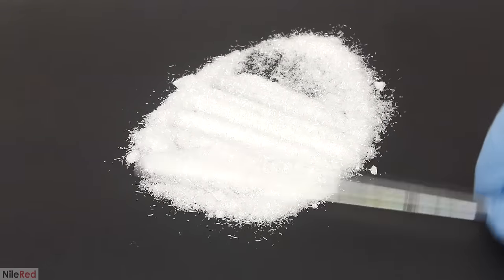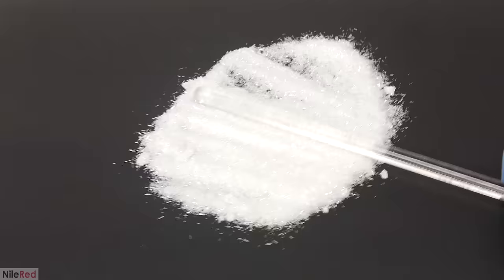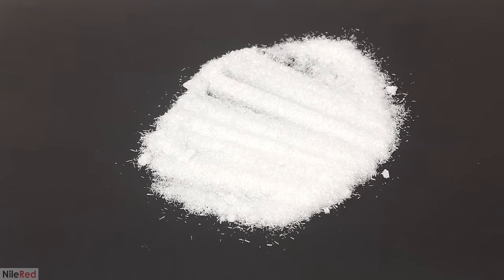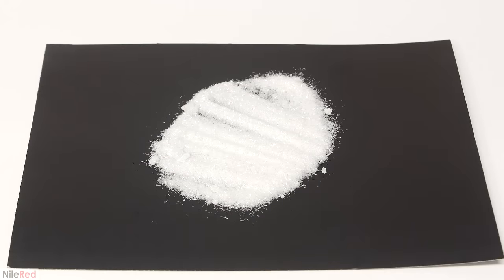First of all, this reaction is pretty sensitive to pH, and if it's either too high or too low, it can affect the yield. My pH papers weren't super accurate, so it was hard to get it in this bracket, and it may have been outside it. Secondly, I think I just used way too much ethanol to recrystallize it, which resulted in a loss. And the last reason is that bitter almond oil is usually nearly pure benzaldehyde, but I didn't purify it before using it, so that might have affected things as well.